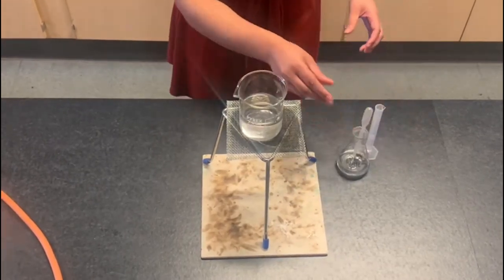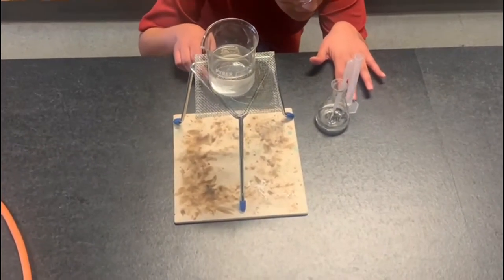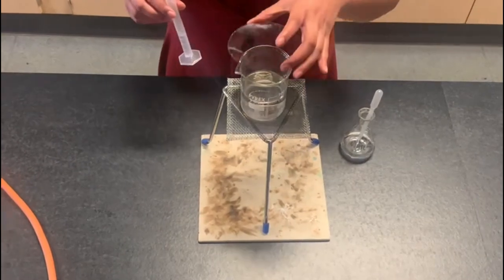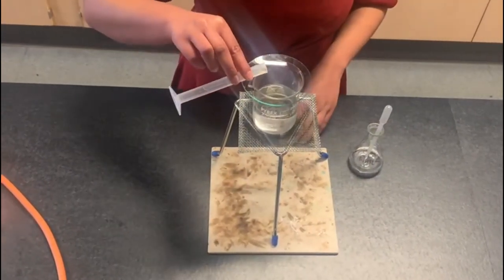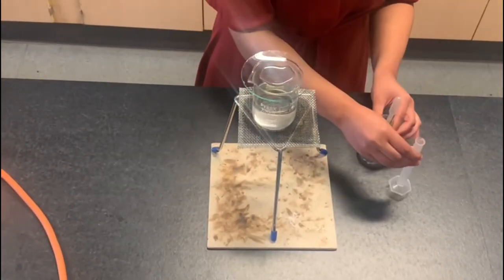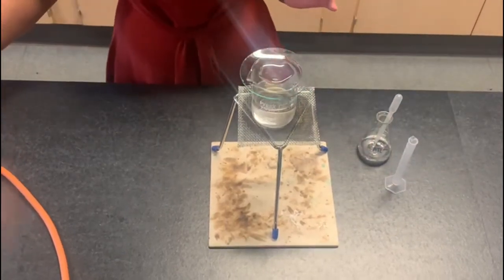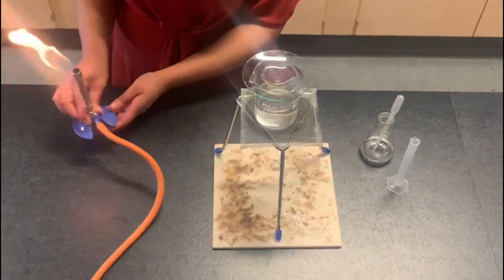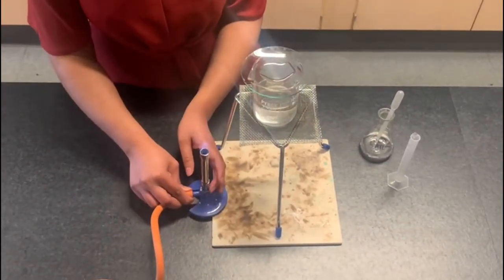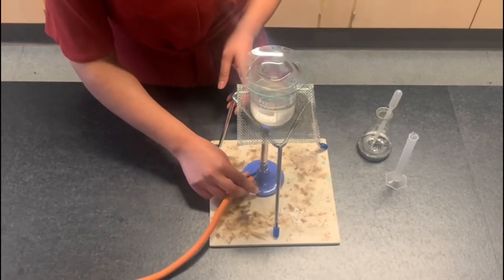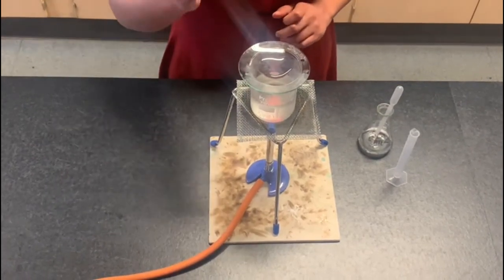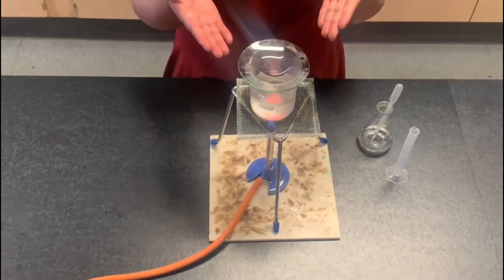Place the watch glass on top of the beaker and pour our sample. We will now move the Bunsen burner over to underneath the beaker but we need to make sure that we change the safety flame onto the roaring flame. And we need to make sure that our water bath does not run dry. So we're just evaporating the water and the solid will then be left behind.